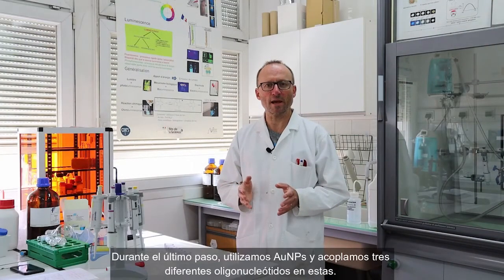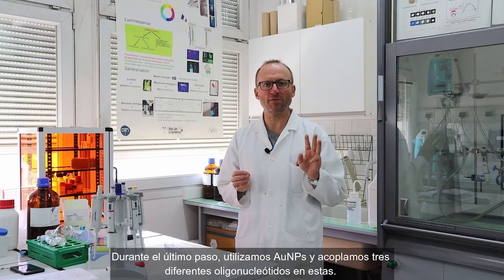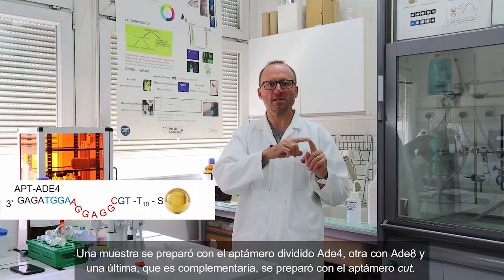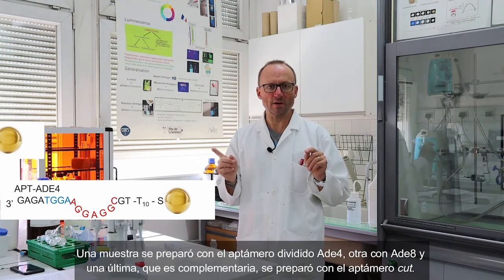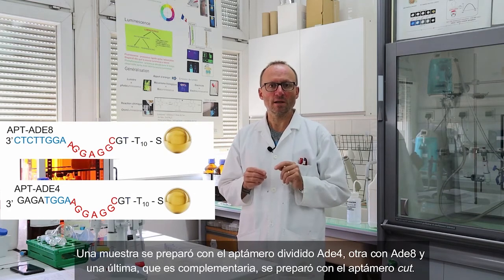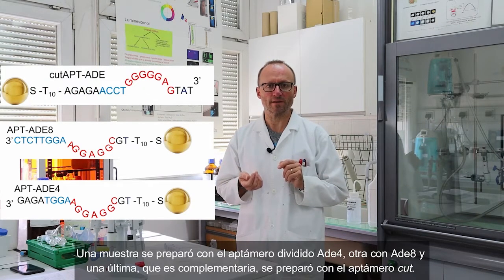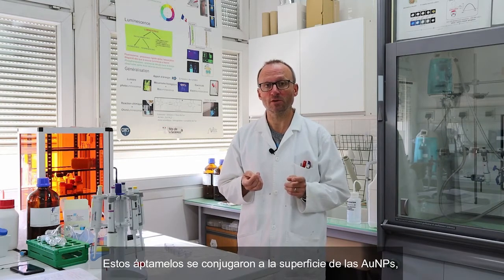So during the last step, we used the nanoparticles and we grafted 3 different oligonucleotides on them. One sample was made of the split ADE4 aptamer. The other one was made with the split aptamer ADE8. And the last one is complementary, and it's made with the cut aptamer strand. Okay? So these guys have been grafted on the nanoparticles.